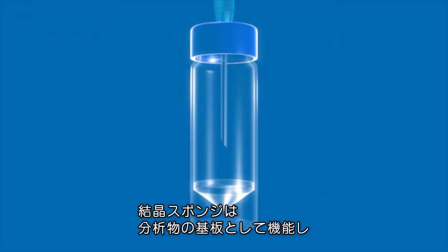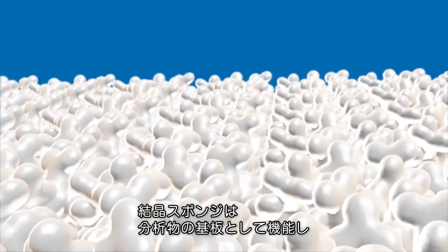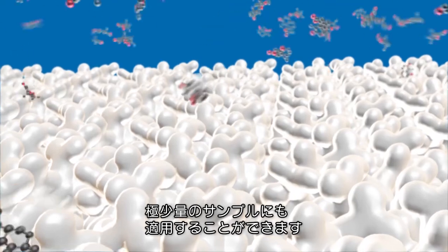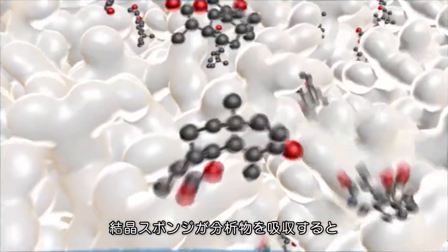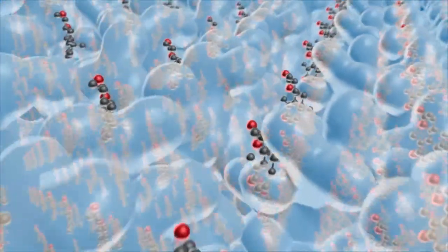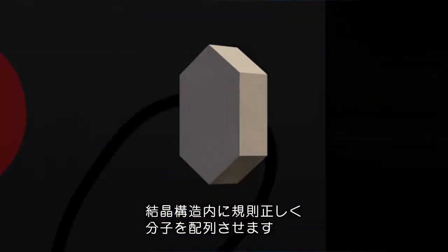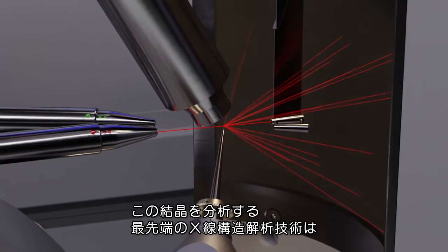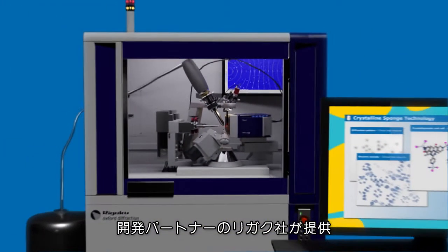The crystalline sponge serves as a substrate for the analyte sample, which can be applied in an extremely low amount. The sponge absorbs the analyte molecule and aligns it in a regular order within the sponge framework. This combined crystal can be analyzed by the state-of-the-art X-ray diffraction technology of our partner Rigaku.